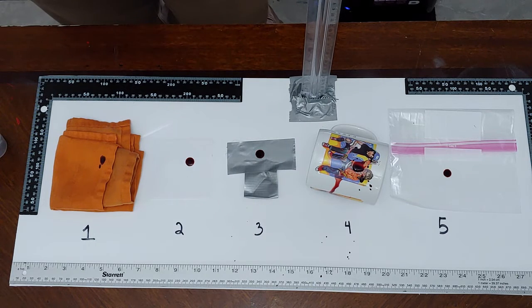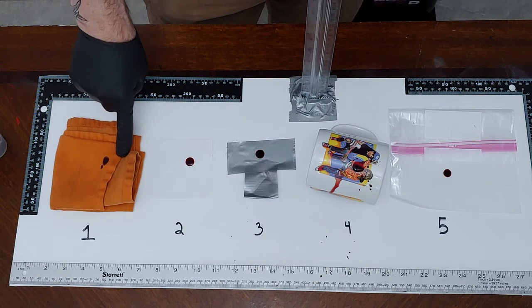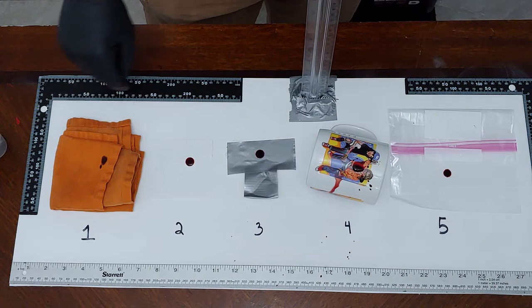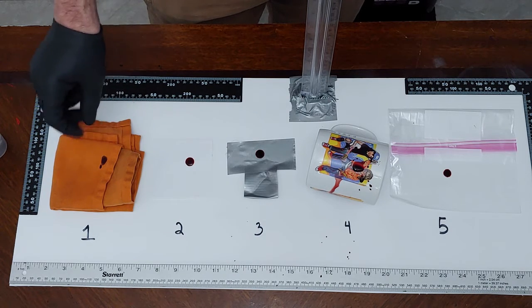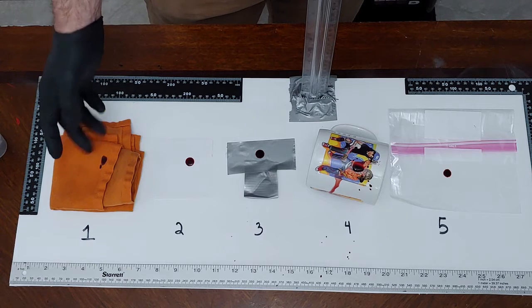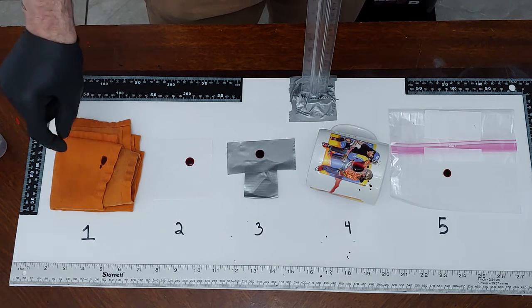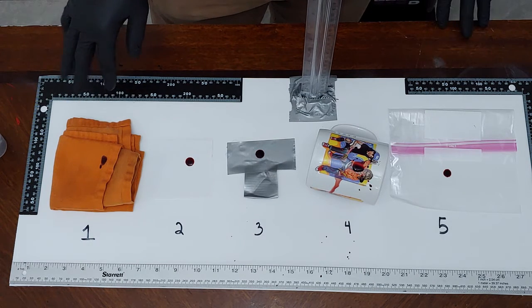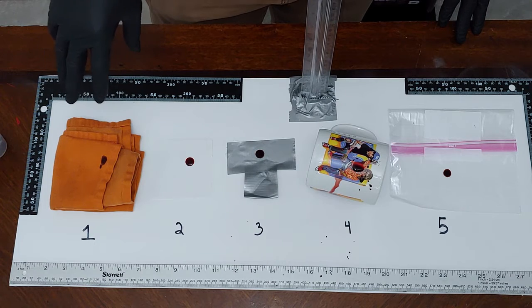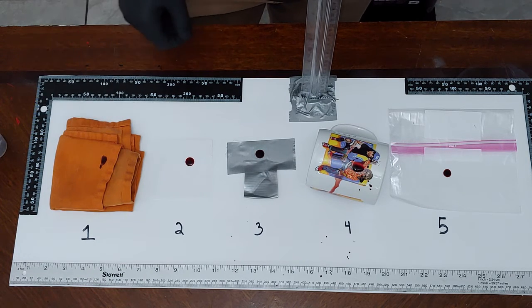Okay, so we're going to look at these right now, just our initial observations. So, on the material, the wet blood saturated into the surface, so you don't see a good circular blood stain. It's rough, it's irregular, it's not a circle. Even though this hit the surface at a 90-degree angle, you do not see a perfect circular blood stain. Be really careful trying to interpret blood stains on material. I would just call this a blood stain on the material that's saturated into the surface.